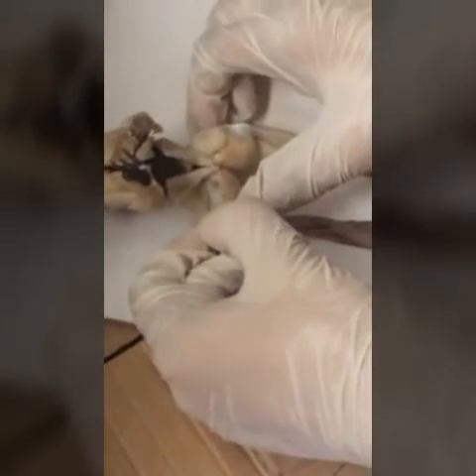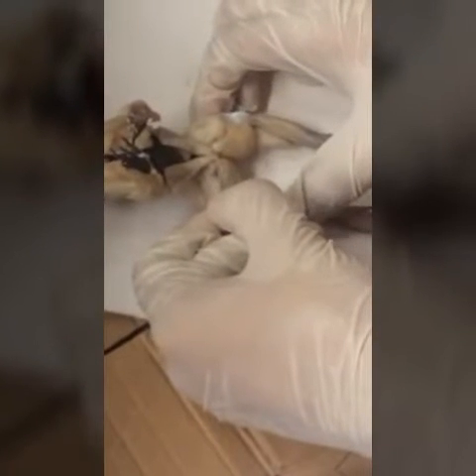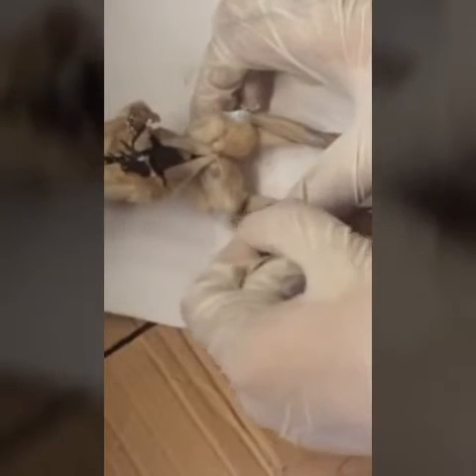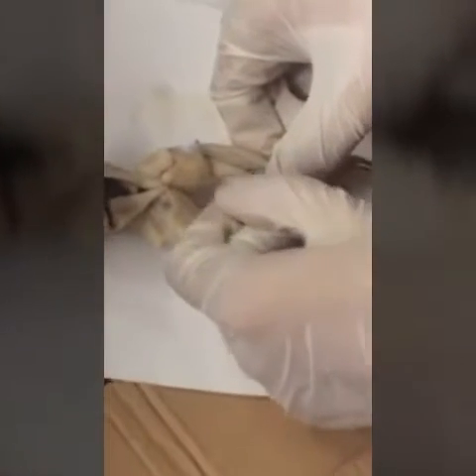Then this is the sartorius muscle again. Then the adductor magnus over here and the gracilis major over here. Then we have the gracilis minor over here. The semimembranosus over here. And we have the semitendinosus over here.